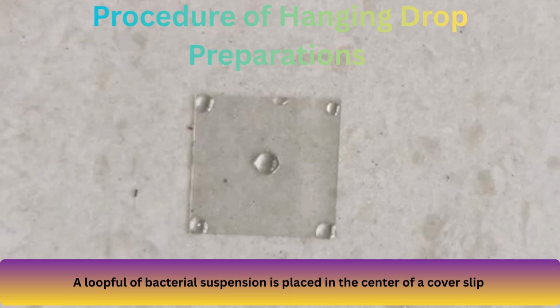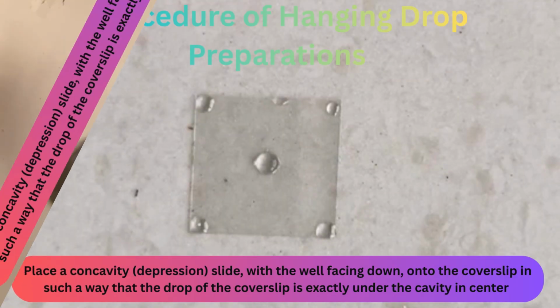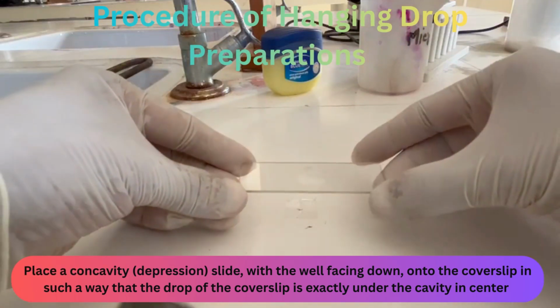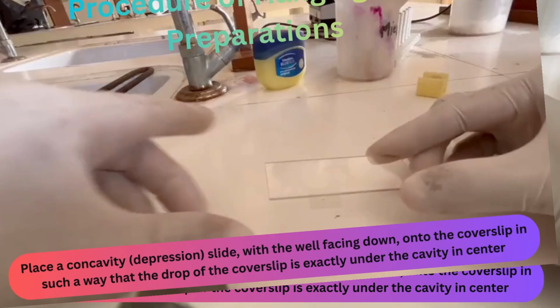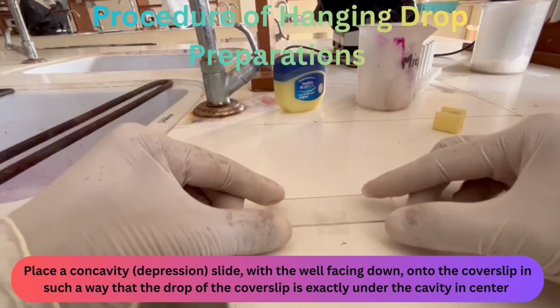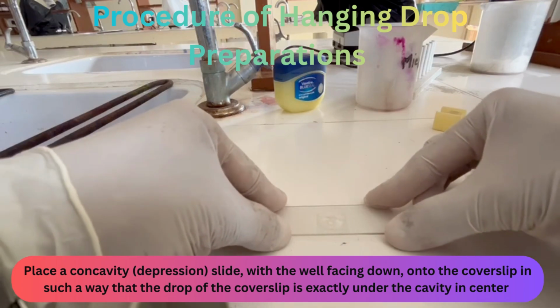now we have to place a small drop of bacterial cell suspension on the center of the cover slip. After that, we need to take a clean concavity slide. Now invert the concavity slide and place it with the concave well facing down, in such a way that the drop of bacterial suspension comes exactly on the center of the concavity.